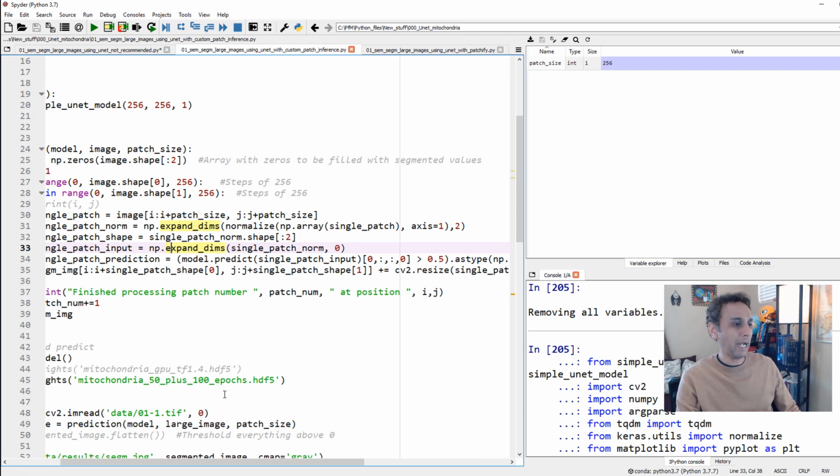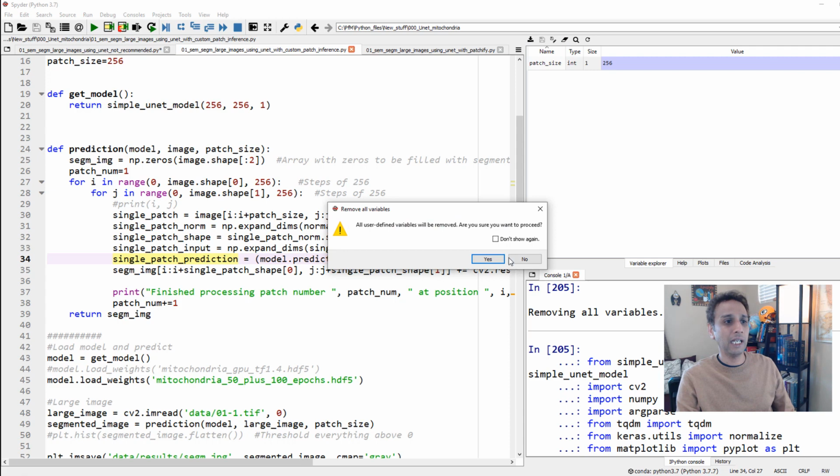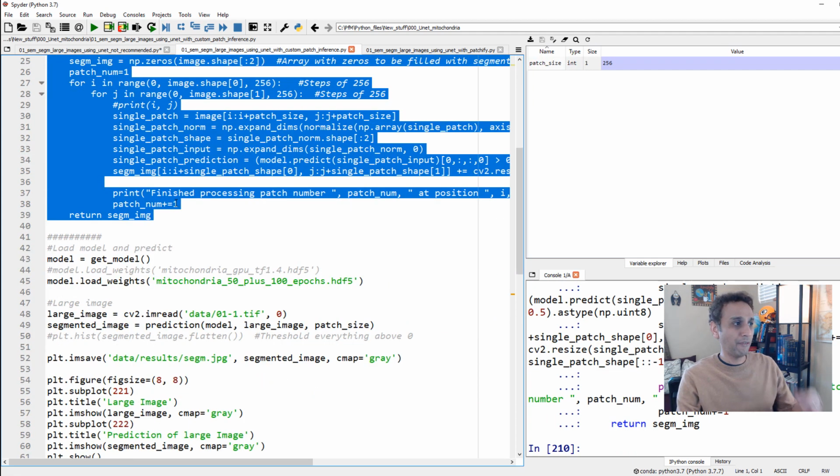And after that single patch is done, I'm going to replace the segmented image. Remember, we have all zeros in segmented image. So replace all the pixels where I have zeros with the values that I'm actually getting from the prediction. That's pretty much it. And then move on until we are done with everything. And basically at the end of it, return the segmented image. That's pretty much it. So let's remove everything and let's run these lines. So far, nothing should happen. We just defined the function.